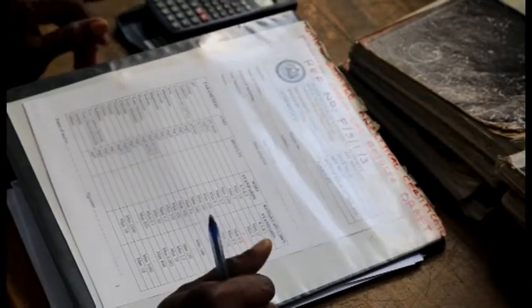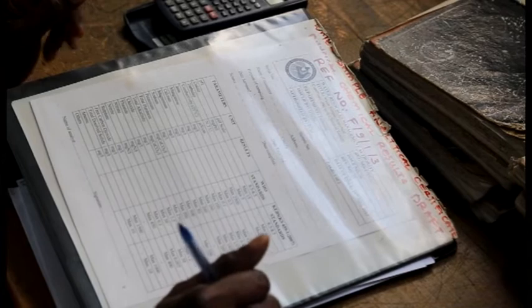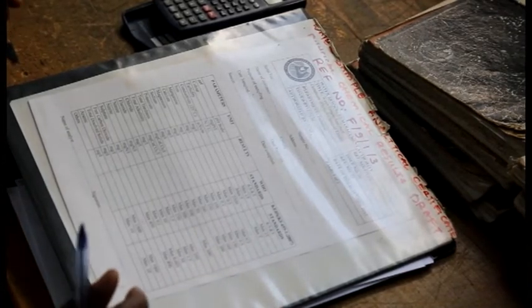After we enter all the numbers in the release book, the date is indicated, the date which the samples were received, the test required, and then the person who compiled the forms.